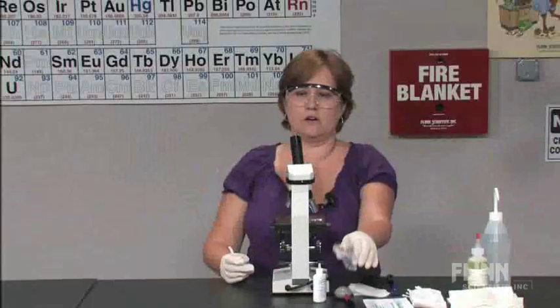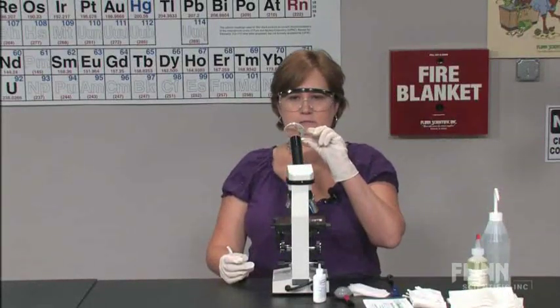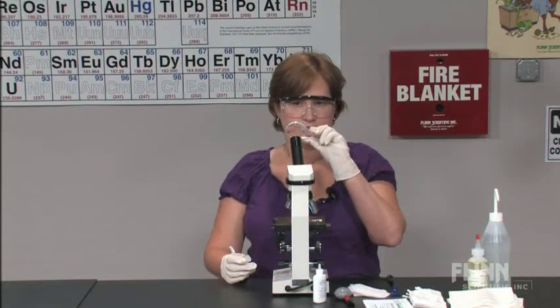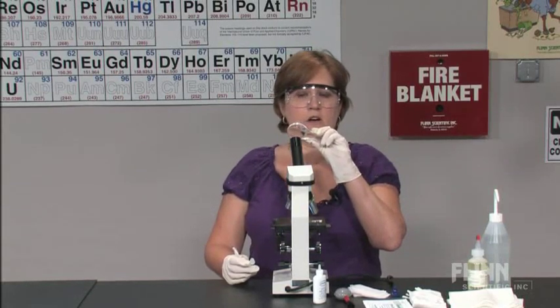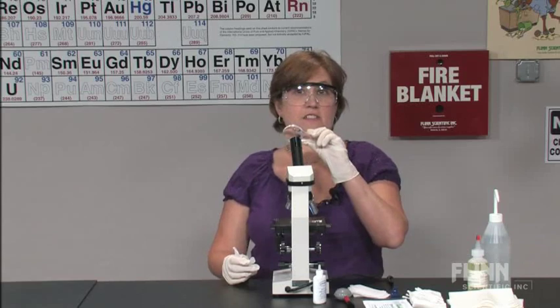If necessary, you can always use a hand lens to make sure that you have everything off of the ocular, or to see if it's a scratch on the ocular itself.